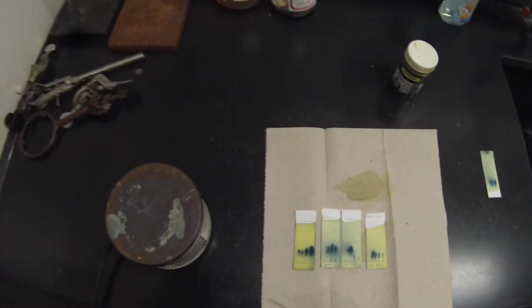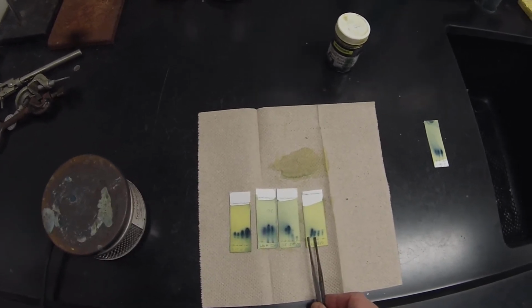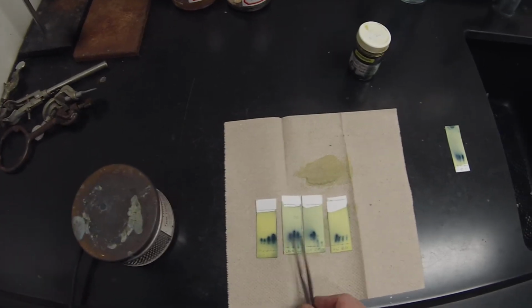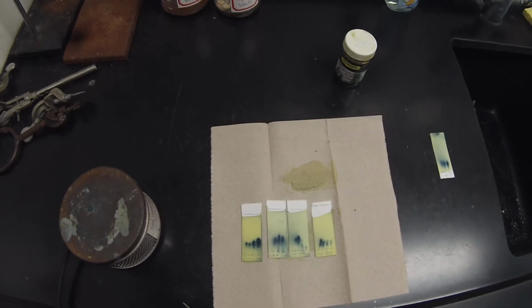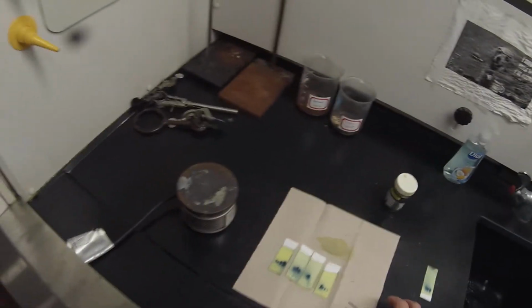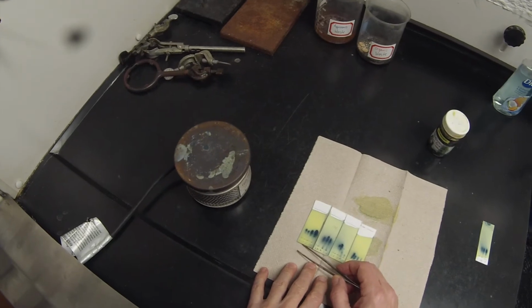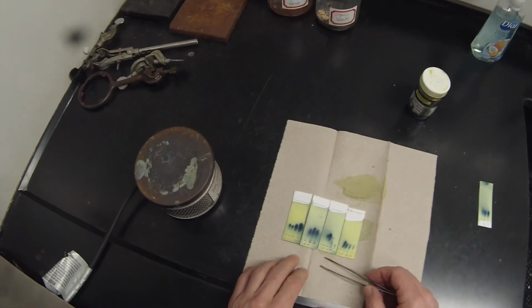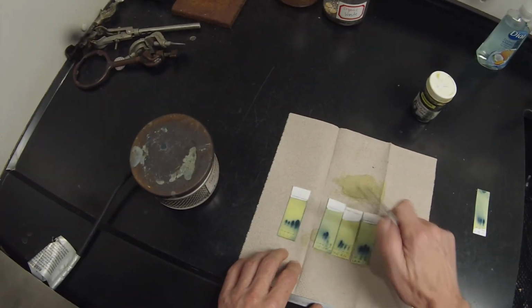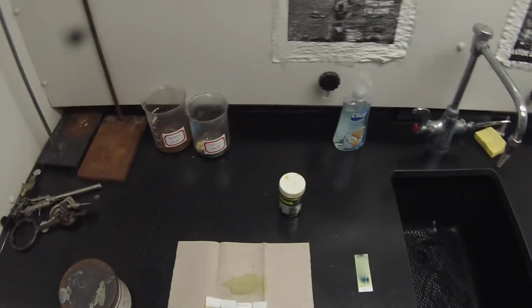So 9, 10, 11, and 12 we definitely keep. 13 we keep. 14 we keep. And I'm going to throw away a little bit by throwing away 15 and 16, but we'll still have plenty. So 9, 10, 11, 12, 13, and 14. Those 6 fractions are the ones we'll collect, and we'll discard the others. I'm going to leave these here because I'm going to take a picture of those. That's the co-spot. We'll move that over. And I'll upload that picture to Blackboard.